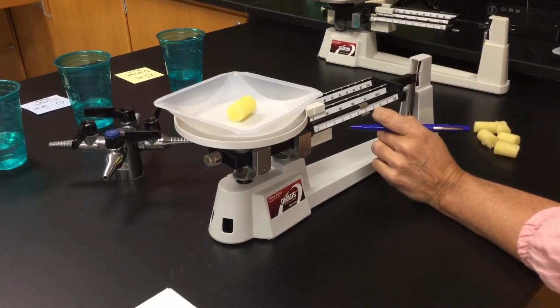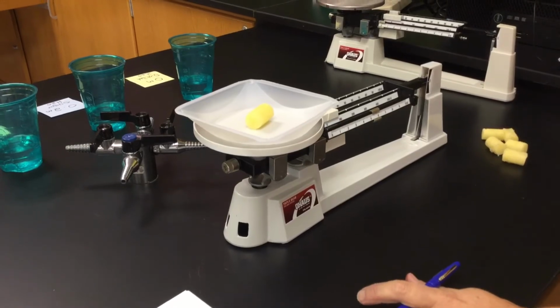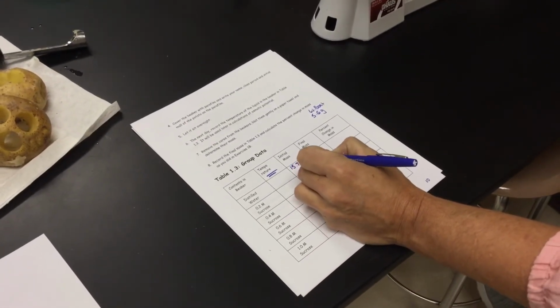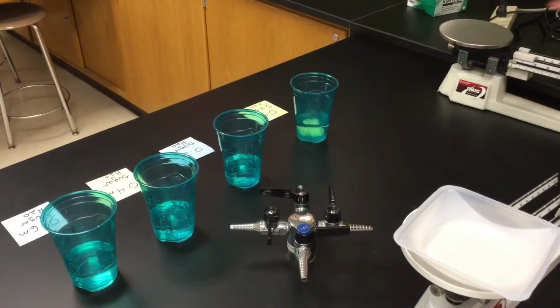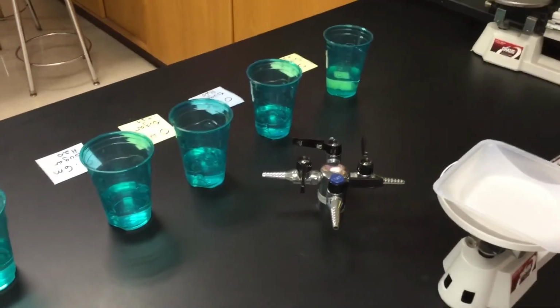So let's say our first one. Let's go with 15.7, so it doesn't really matter. Let's say the first one will go to distilled water. It was 15.7 grams minus our 5.6 grams weigh boat, which will give you your initial mass. I'm sticking it into my cup that says distilled water, which is what's inside that cup. Now my only variable is what's inside the cup. Unlike the second part where the bag was different, my potatoes should all be the same.